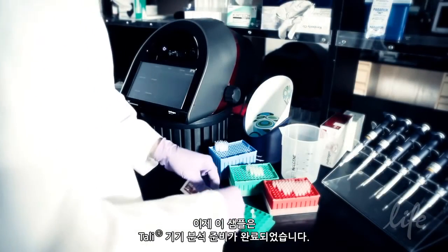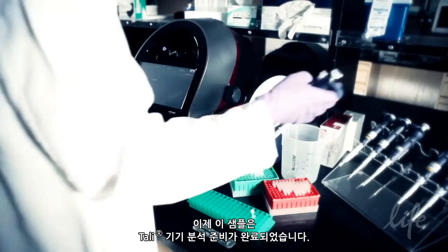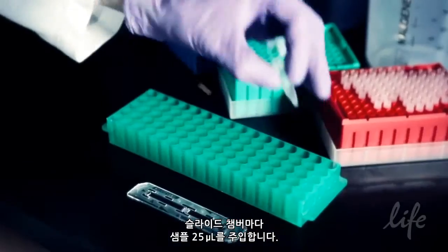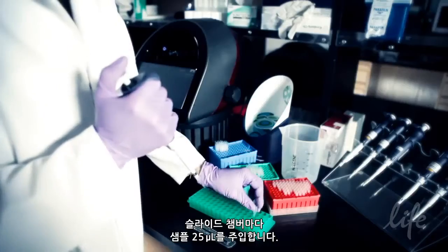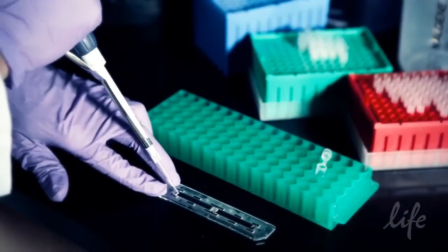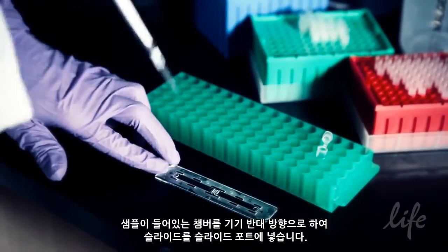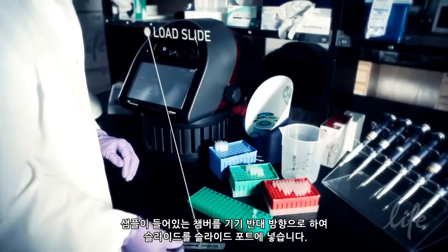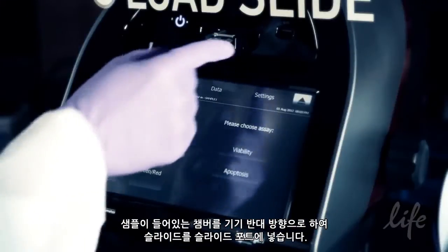The sample is now ready to be analyzed on the Tali instrument. Simply pipette 25 microliters of the sample into one of the slide chambers. Load the slide into the slide port with the chamber containing the sample facing away from the instrument.